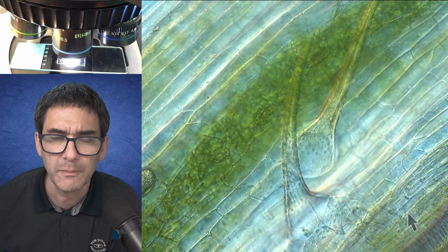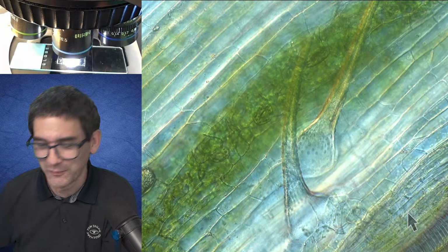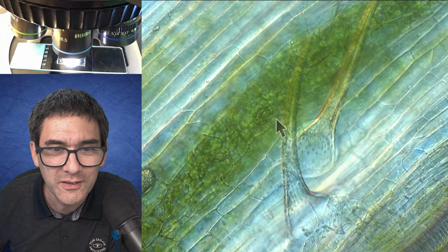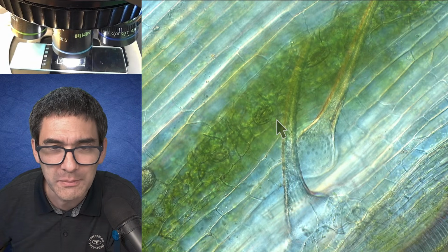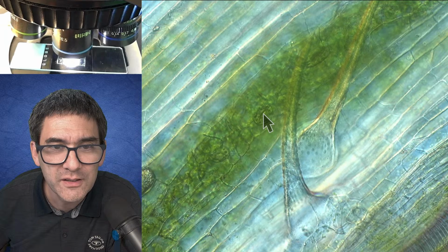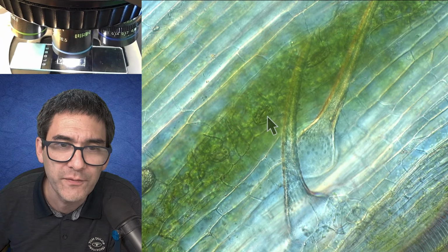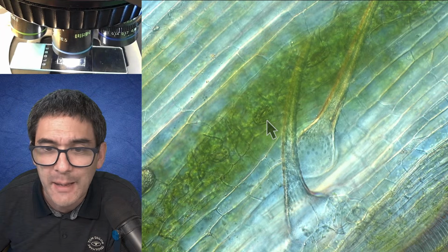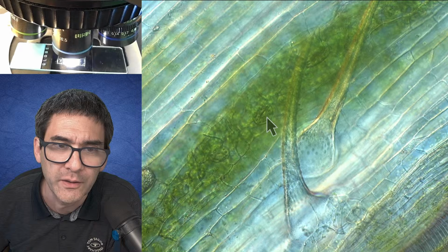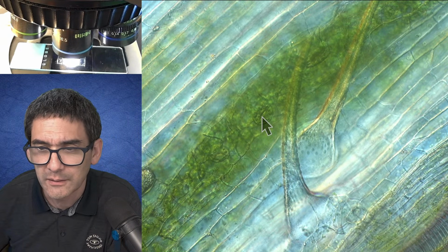Ah, look at this. Also fun. Look, you gotta watch very carefully. These are stomates. Do you see those things here? Okay, my mouse is a little bit acting up. Now it goes again. You see this here, right? There's a little tiny hole here. These are stomates, which are openings, which I kind of find interesting because I'm looking right now at a stem, right? You can find those stomates on the bottom side of a leaf. Yeah, I kind of like this.